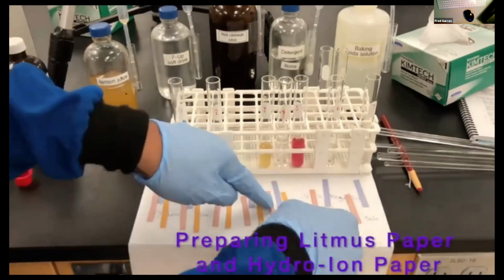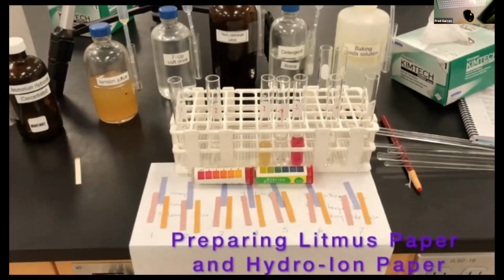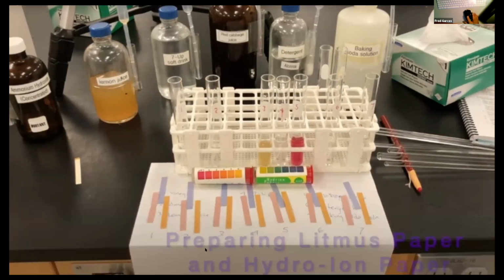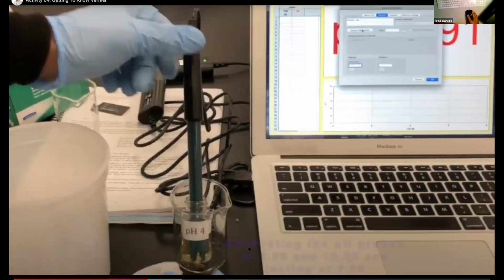You have the solutions, and then you have litmus paper, and you have something called hydrion papers. Hydrion papers will change color depending on the pH. So what happens first? Well, we're just going to test each one of these individually.